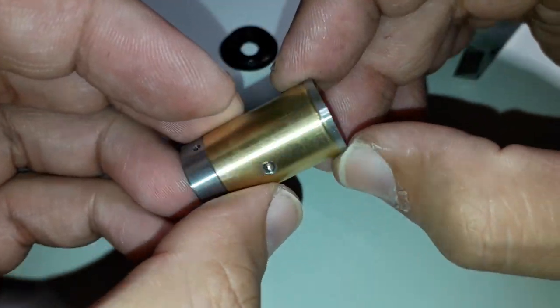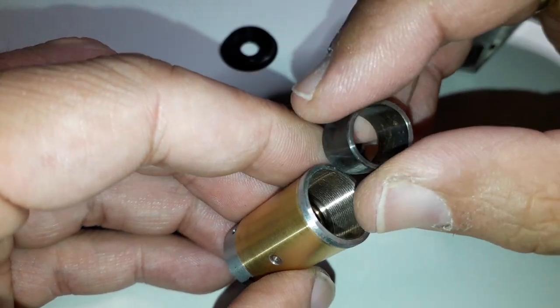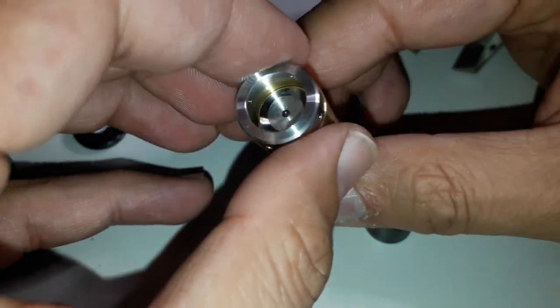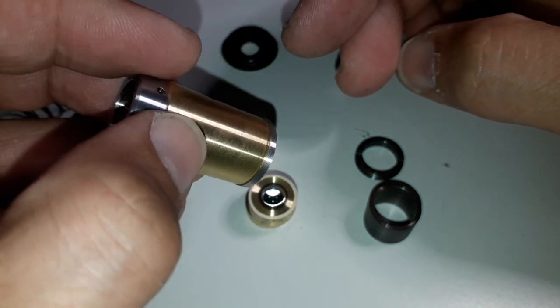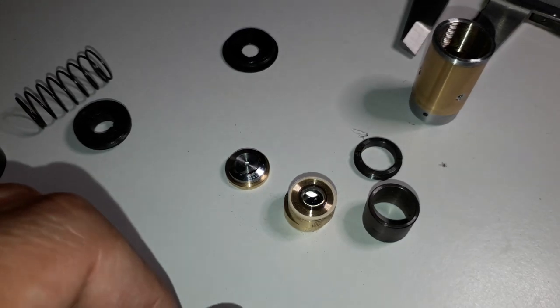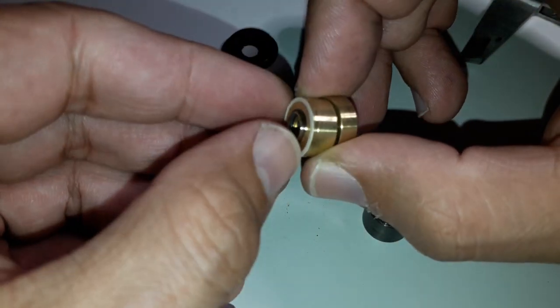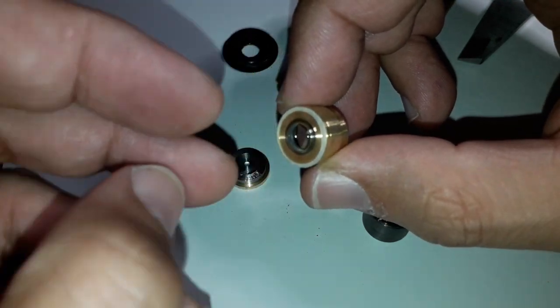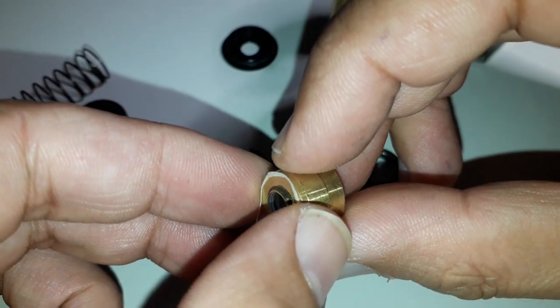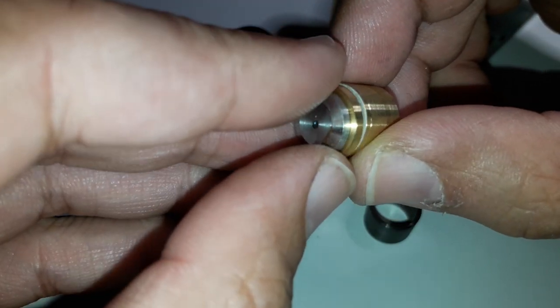This ring held all of the lens elements, and I could not push them out directly. There was also a smaller barrel in there holding the lenses in place. That is the so-called heart of the objective — this is basically where we can find the individual lens elements. There are several of them, of course. It could be that the individual lenses are not individual, but made of smaller elements. There was some kind of a plastic or Teflon ring, maybe also a spacer. The lenses were either glued or held in place in what seems to be made of copper.